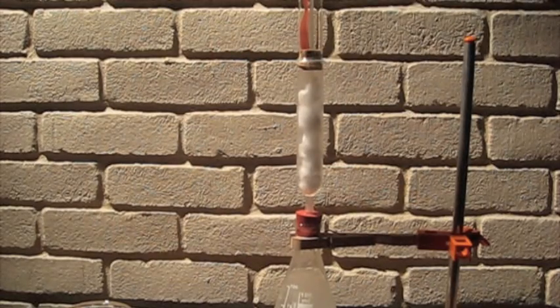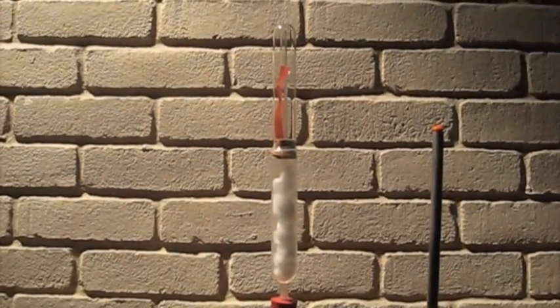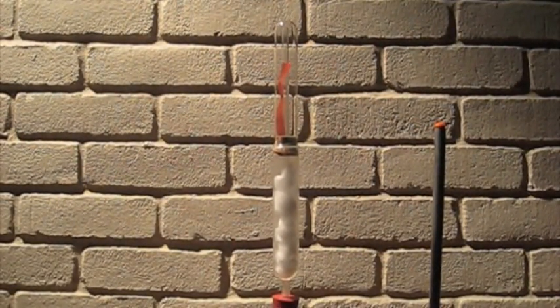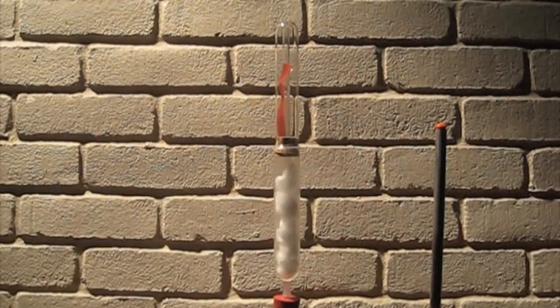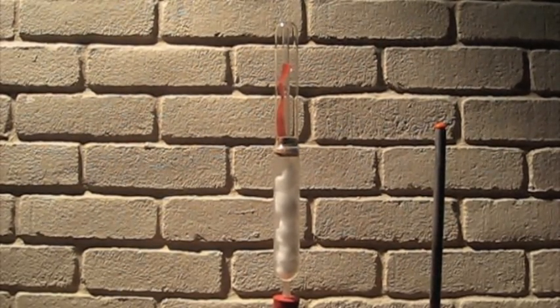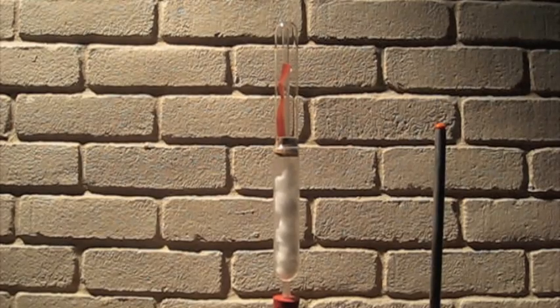The basic setup is a flask containing calcium hydroxide or sodium hydroxide with ammonium chloride attached to a plastic test tube or syringe with cotton balls in it. I'm not sure what the cotton balls do but it's from my kit so I'm following the instructions.